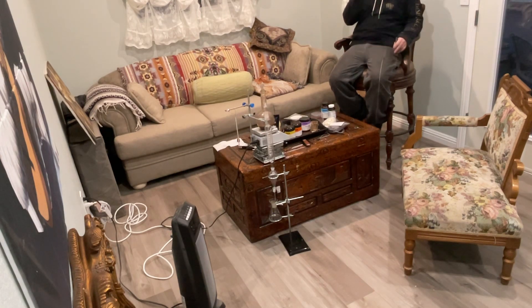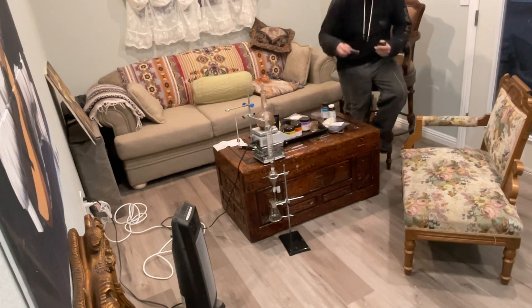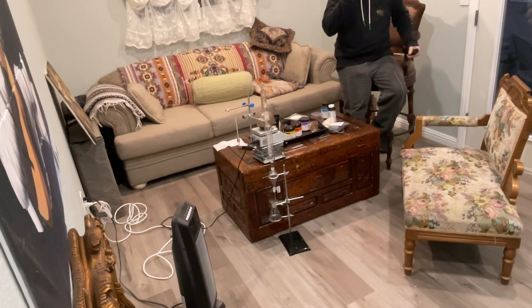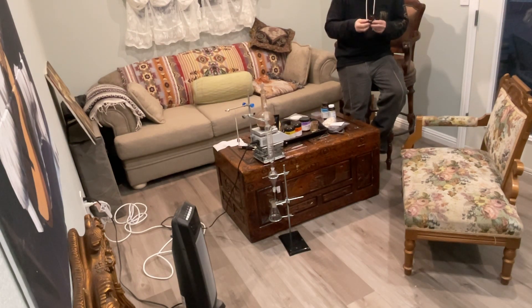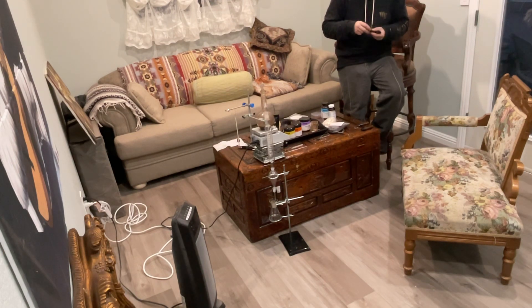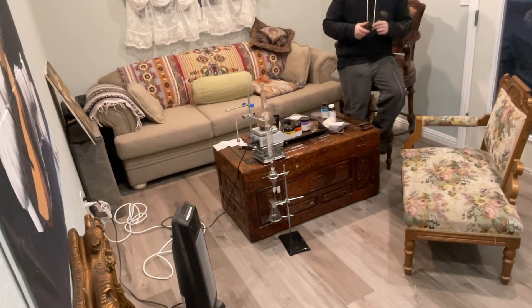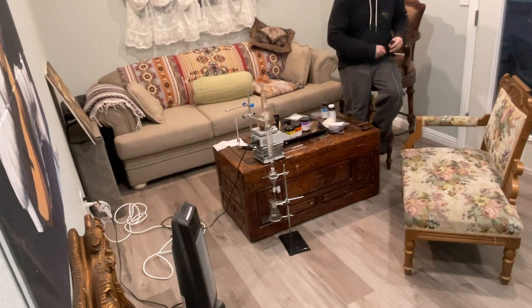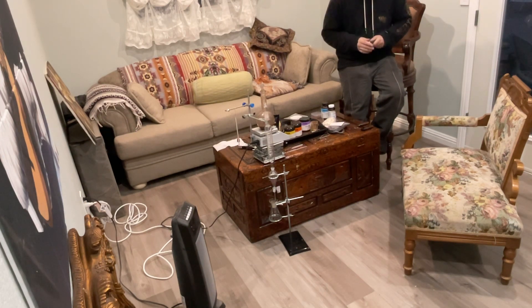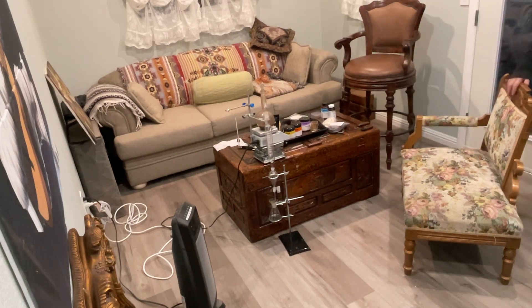Now and again when it's sitting there — this one's been sitting for 24 hours — the weather here in Nevada is a desert but there's still weather. When it's moist here it's crazy. The barometric pressure changes during the day, so you just want to pop it open now and again every morning after you charge it. This is a thicker medium than most, so maybe a bit of ethanol would be a good idea. But what I'm getting at is I'm trying to achieve consistency.